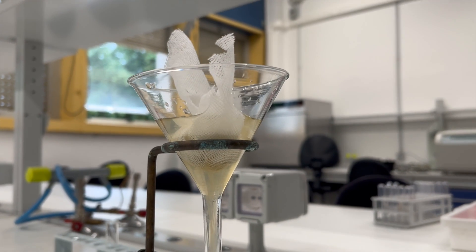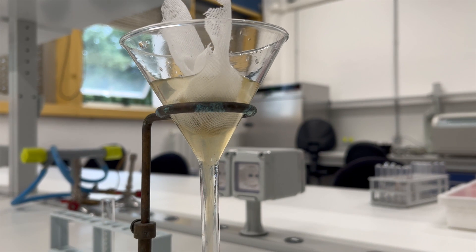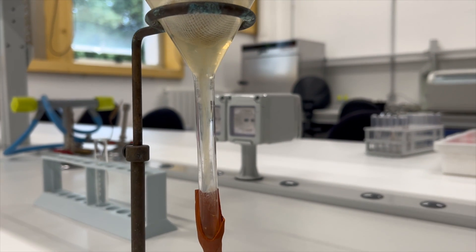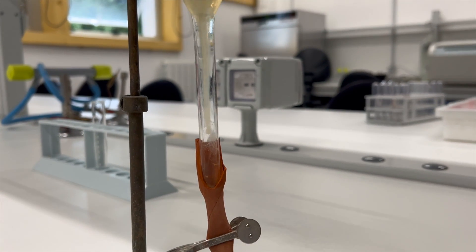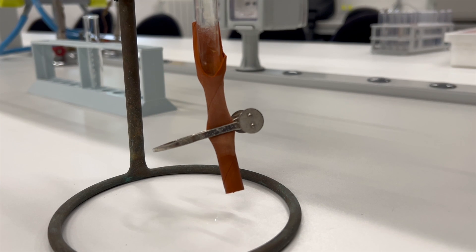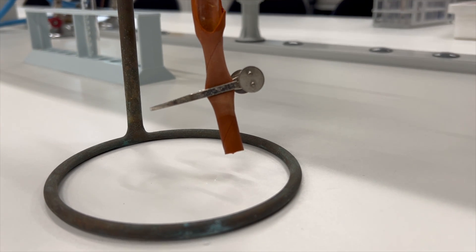Let the sample sit at room temperature for at least 12 hours to allow the motile larvae to escape from the fecal pellet and settle at the bottom of the funnel.